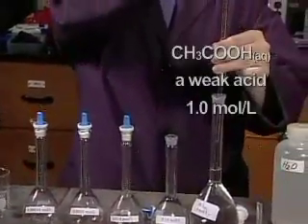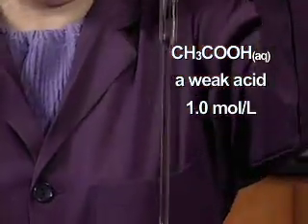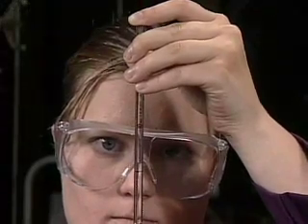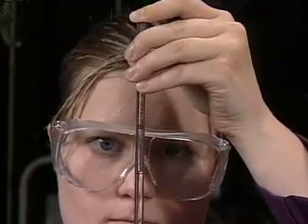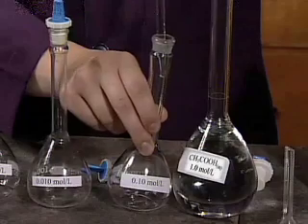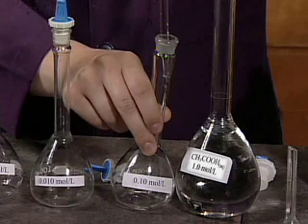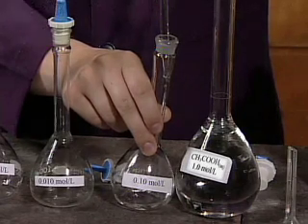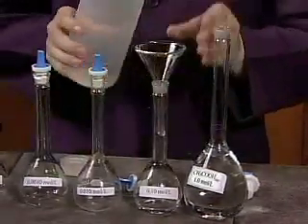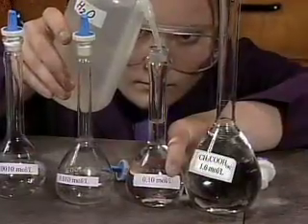Biologists are also interested in the effects of weak acids. The third demonstration is the serial dilution of 1.0 mole per liter ethanoic acid, a weak acid. 10.0 milliliters of 1.0 mole per liter ethanoic acid are transferred to a volumetric flask using a volumetric pipette. Again, deionized water is added from a wash bottle and used to fill the flask exactly to the 100 milliliter calibration line.